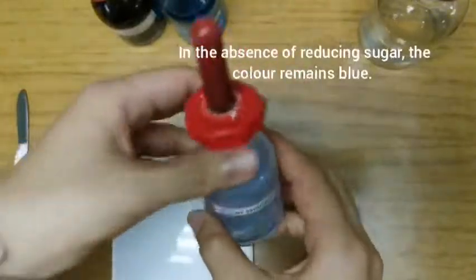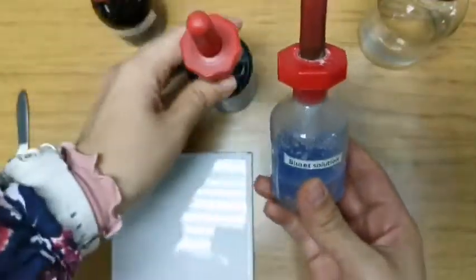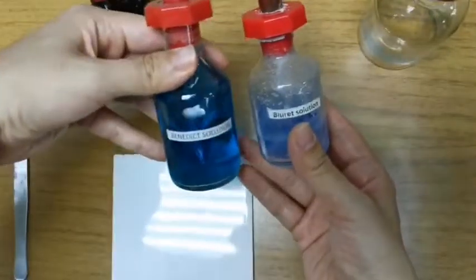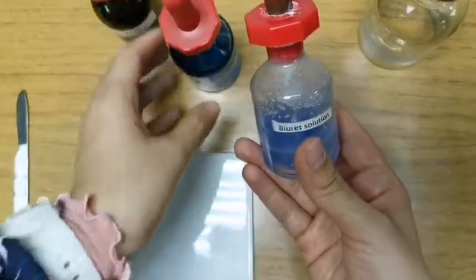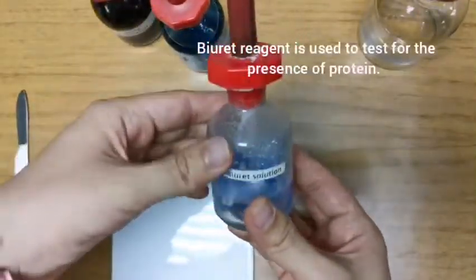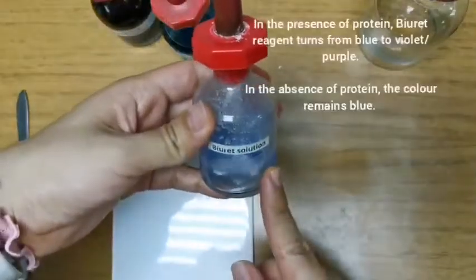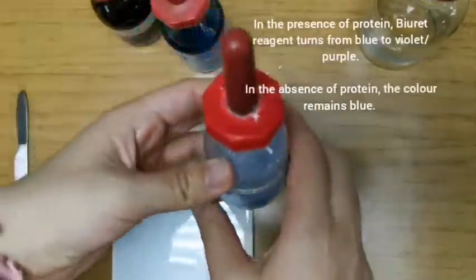For tests for proteins, we have biuret. This is also a blue solution, but you can see that the color is slightly different from Benedict's solution. The label will be clearly given to you in the test or in your practical, so make sure that you read the labels properly. Biuret is used to test for proteins. In the presence of protein, this blue color turns violet or purple.